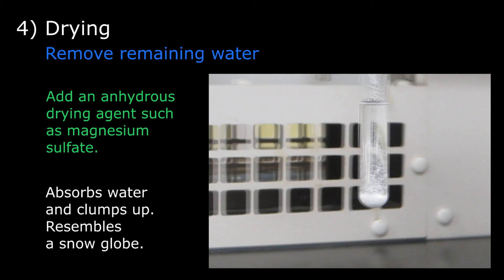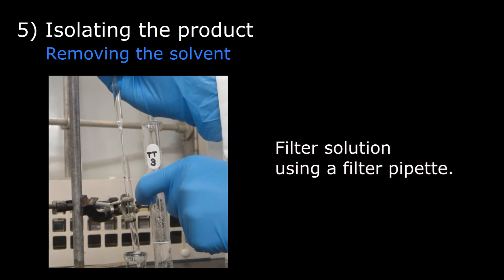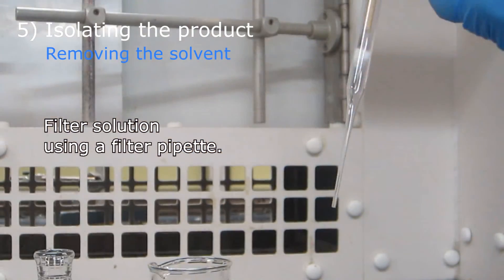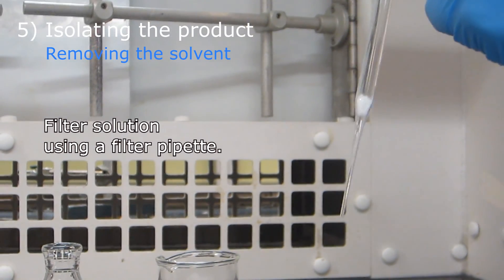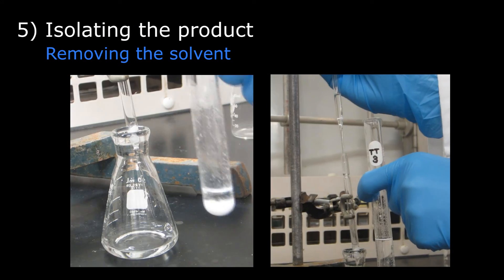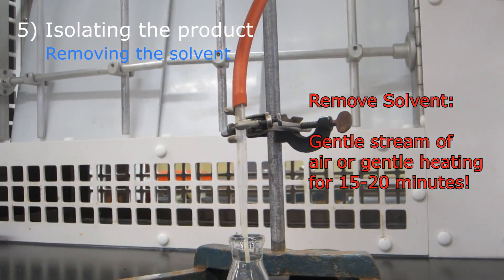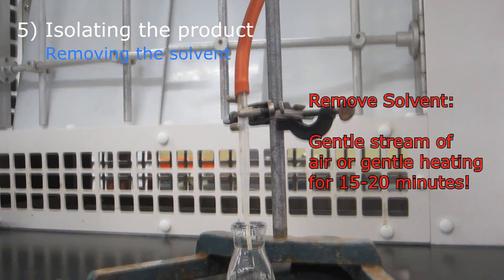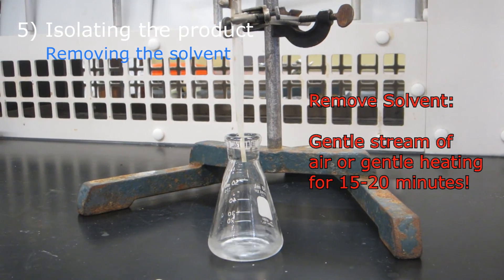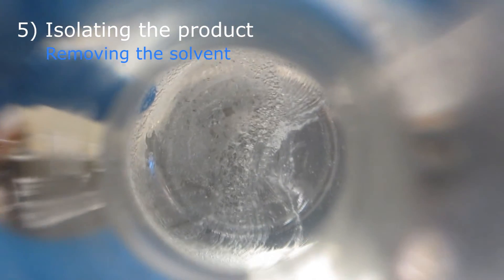The appearance of the swirling solution should resemble that of a snow globe. The drying agent is now filtered using a filter pipette, which can be made by pushing a small piece of cotton down into a pipette using a wooden dowel. The collected solution is transferred into a pre-weighed Erlenmeyer flask. Finally, the solvent is removed from the desired organic compounds using a gentle stream of air or gentle heating for 15 to 20 minutes. Once the solvent is removed, the mass of the crude product can be recorded.